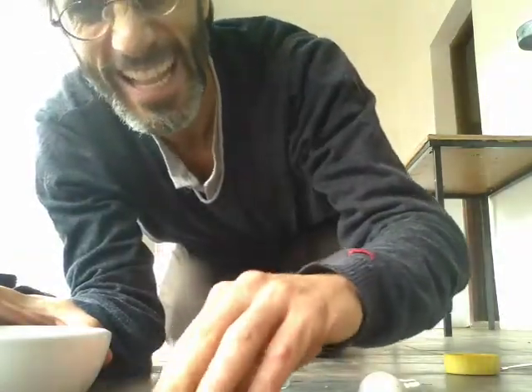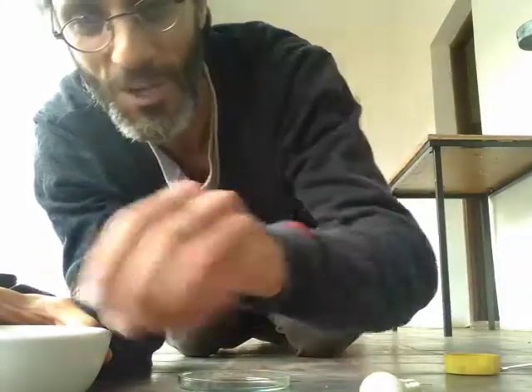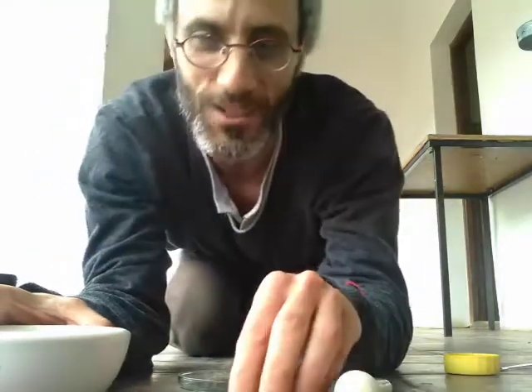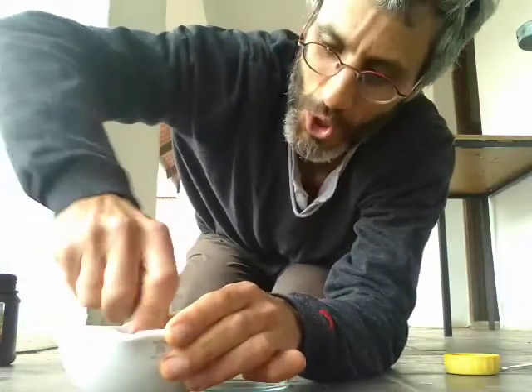Now, I think I've shown you iodine already earlier this year. And this experiment we're going to do now is a little bit similar. It has kind of the same result as the experiment I showed you, but it is actually different. So iodine is a solid. Okay? It belongs to group 7. It's a halogen. And the one cool thing about iodine, which I think I already showed you, is that it sublimes.